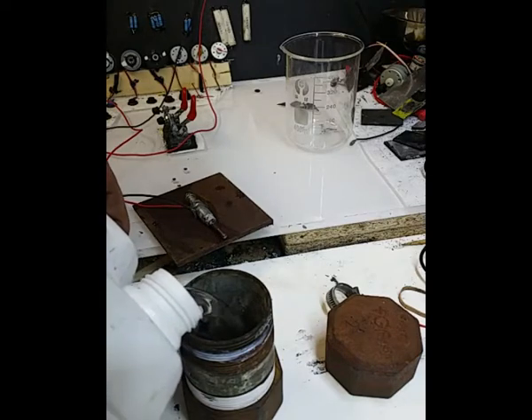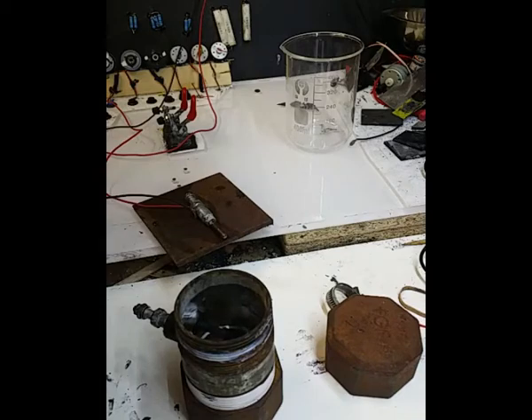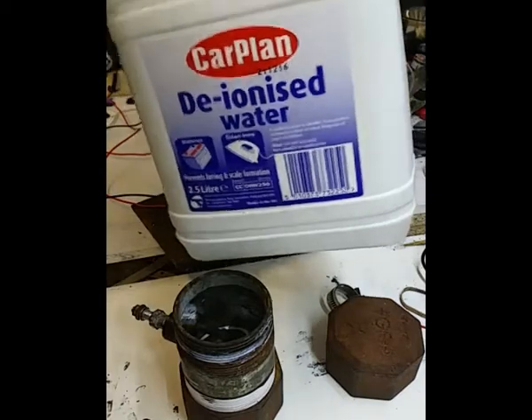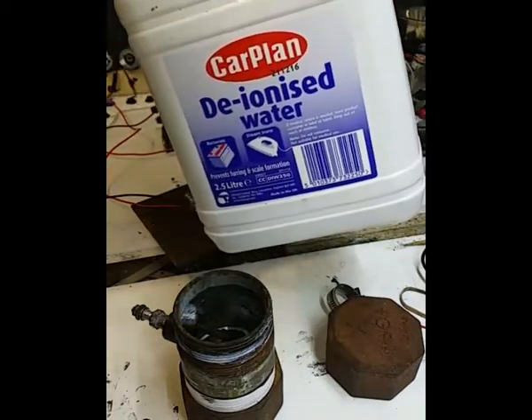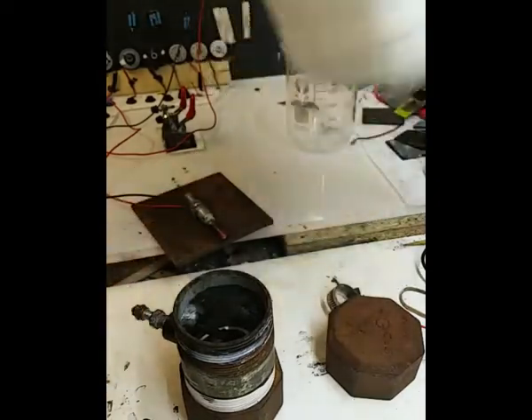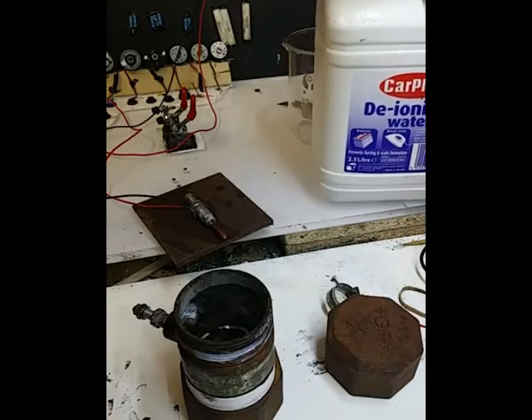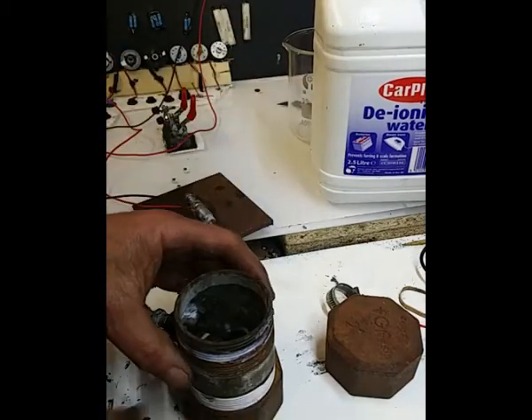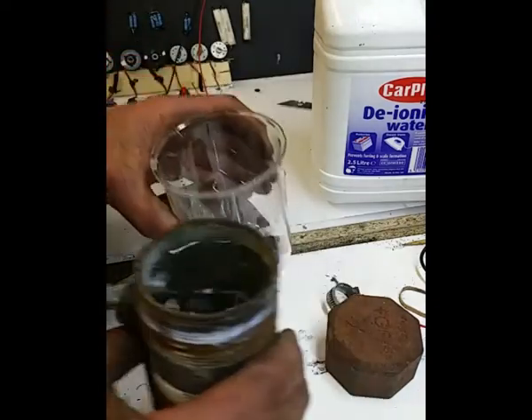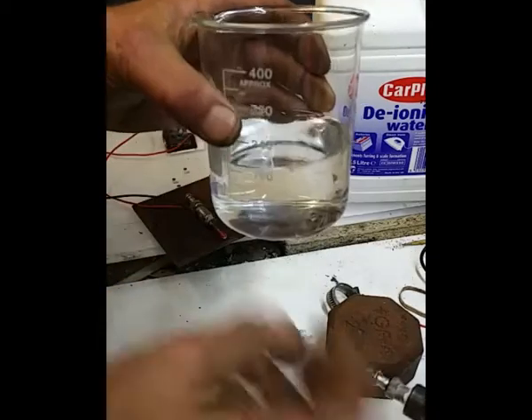So what I'll do, now you would think that that's a waste of DI water really, but you see that there? I've said it before on my other videos. Tesco's at the moment in the UK, 55p for 2.5 litres, still on special offer. I've bought about 40 or 50 of them now. I've just got them everywhere. So anyway, that's full to the brim, but let's have a little look and see what the actual capacity is.